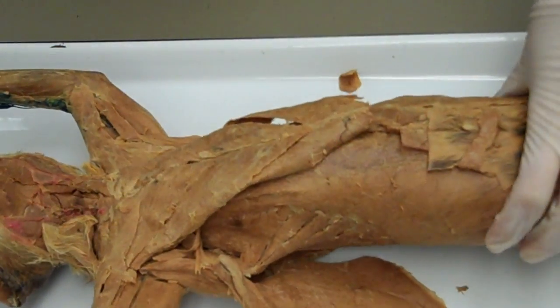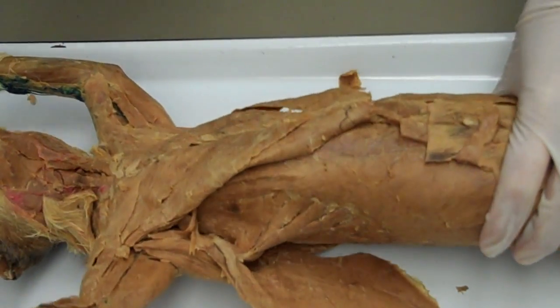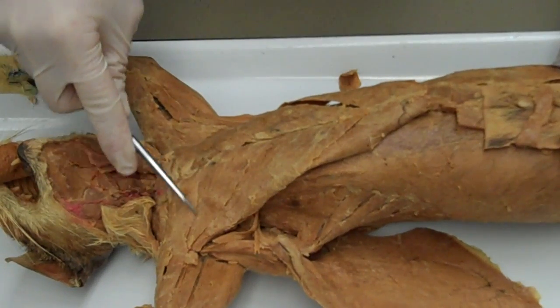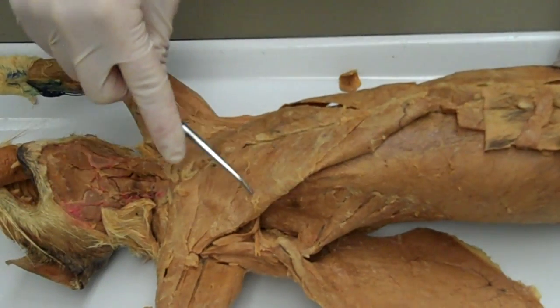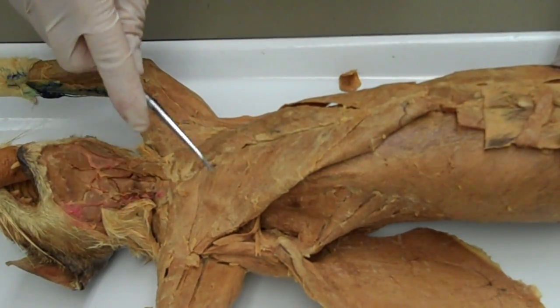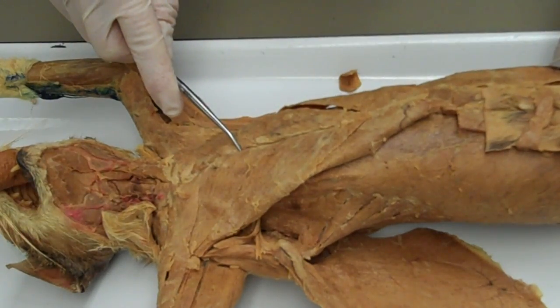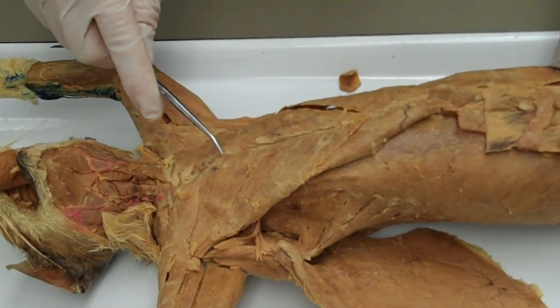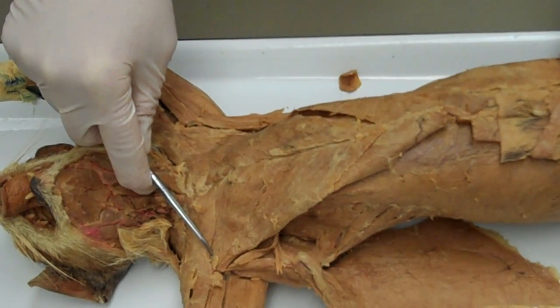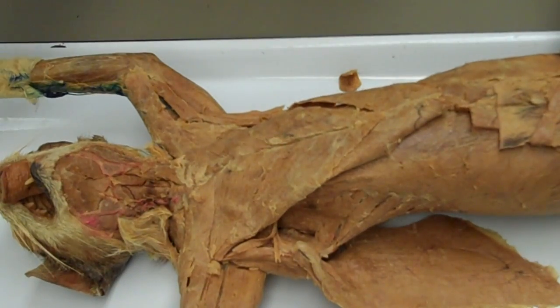Coming back to the anterior aspect of the cat, I'd now like to show you this muscle, which is more superior to the pectoralis minor. This muscle is the pectoralis major. The pectoralis major has its origin on the clavicle, the sternum, and the costal cartilages, and inserts on the greater tubercle of the humerus. Its job is to flex, adduct, and medially rotate the arms.